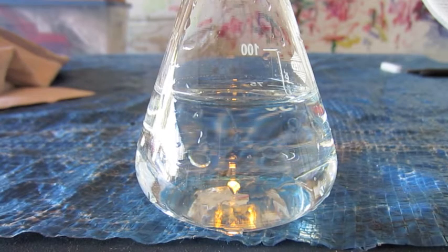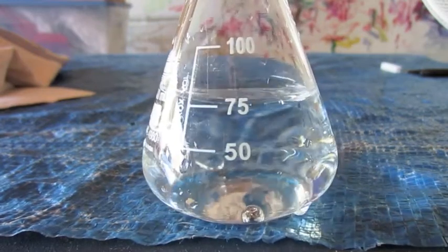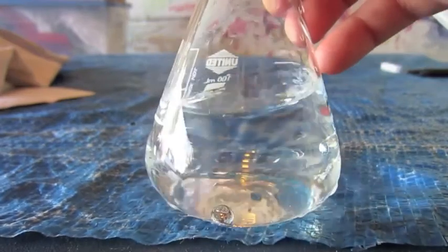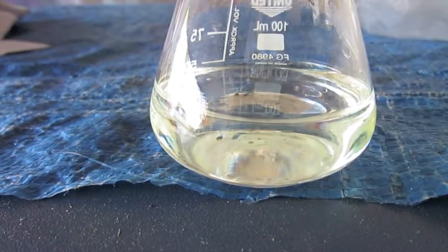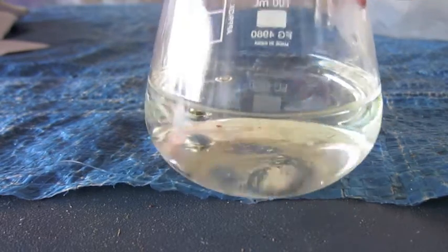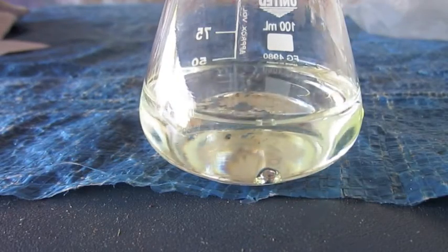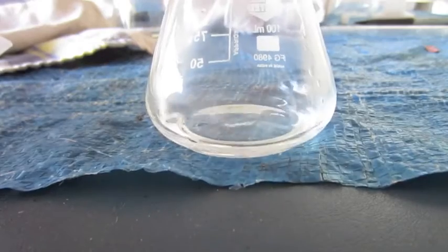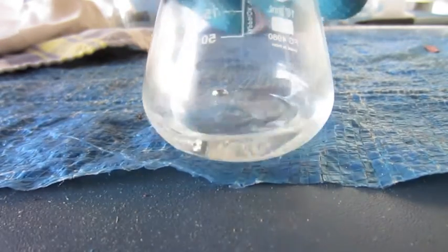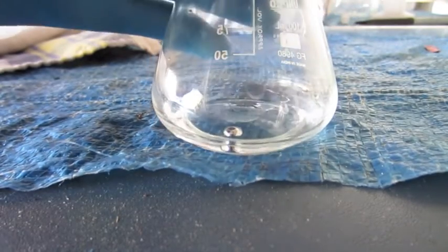Now that gold has come to the aqua regia, we're on to ruthenium. And just to be scientific, I decided to put ruthenium in water. And there you see, it's not reacting. Okay, now this is some concentrated hydrochloric acid. And there is the ruthenium. And this is probably pretty obvious, but it's not reacting. On to nitric acid. Okay, here's some nitric acid, and there's the ruthenium metal. And it's not reacting.